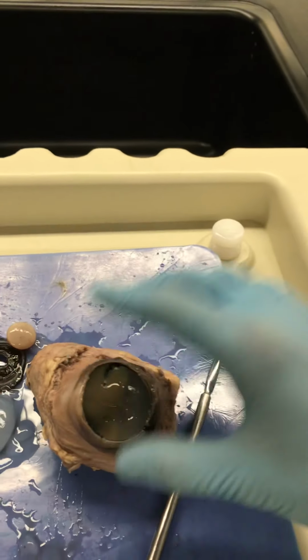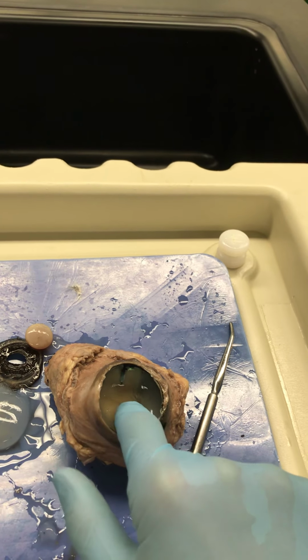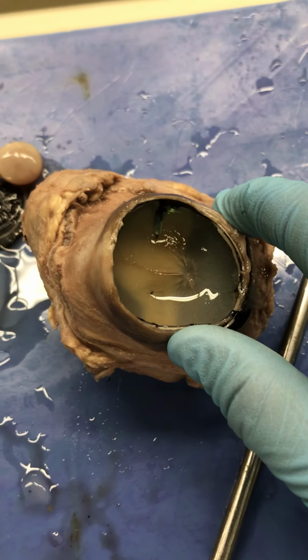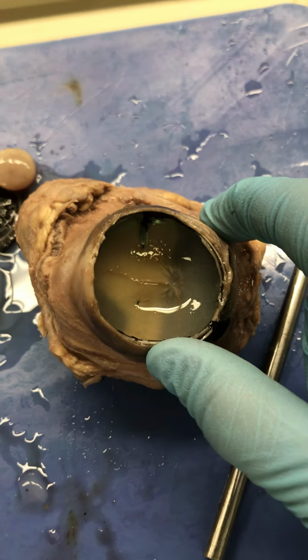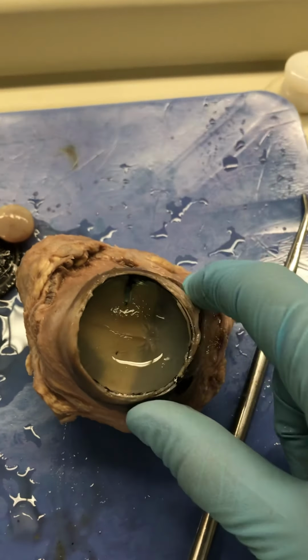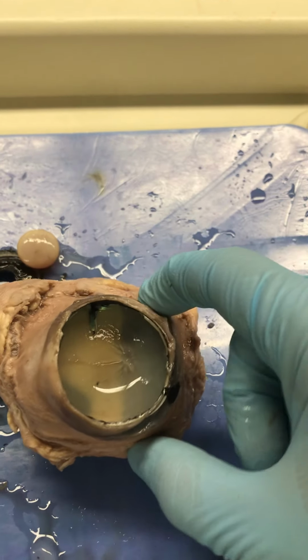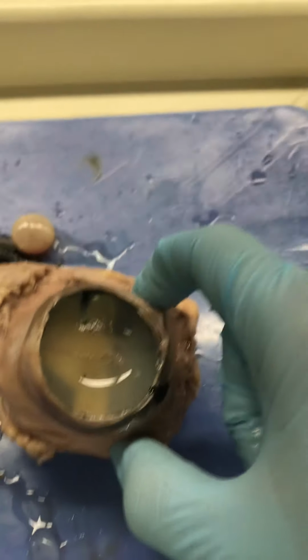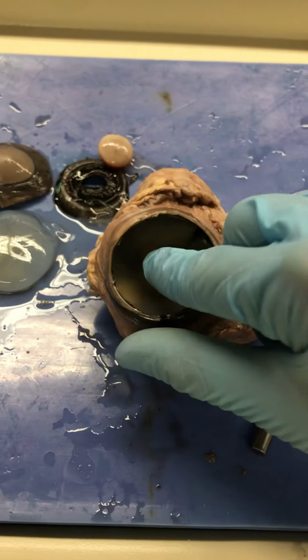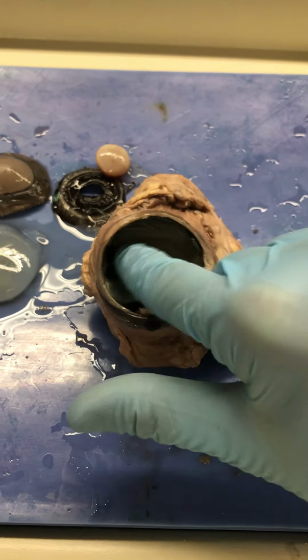And so this is actually like your blind spot. And then around that will be a very important part called the macula lutea or fovea. Anyway, of course I can't see that here, but it's where you have a cluster of neurons that help you see your vision the sharpest, like your color vision and such. Humans are lucky. We see a lot of color. Not all animals see a whole lot of color, as you guys are aware of, and it's because of the different types of nerve cells that we have in our retina and what wavelengths of light they can respond to.